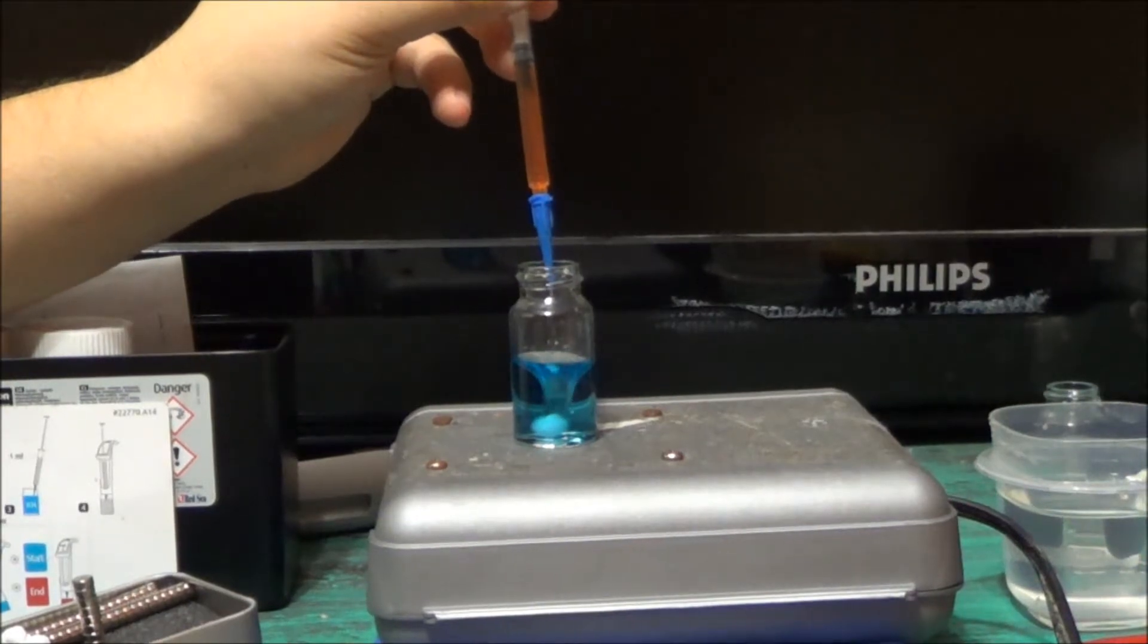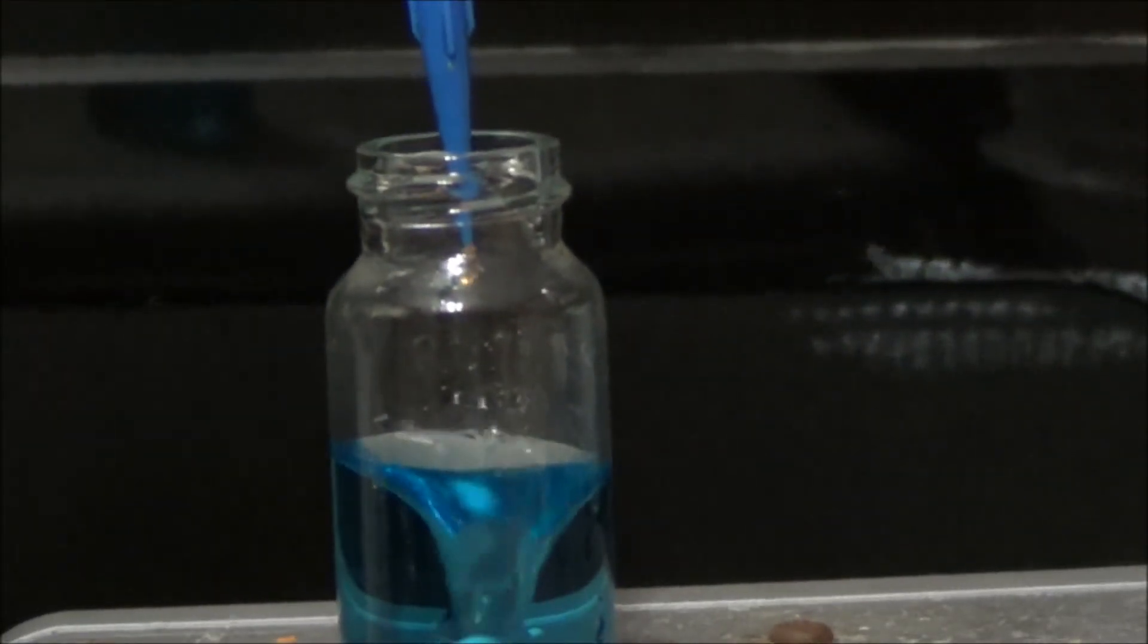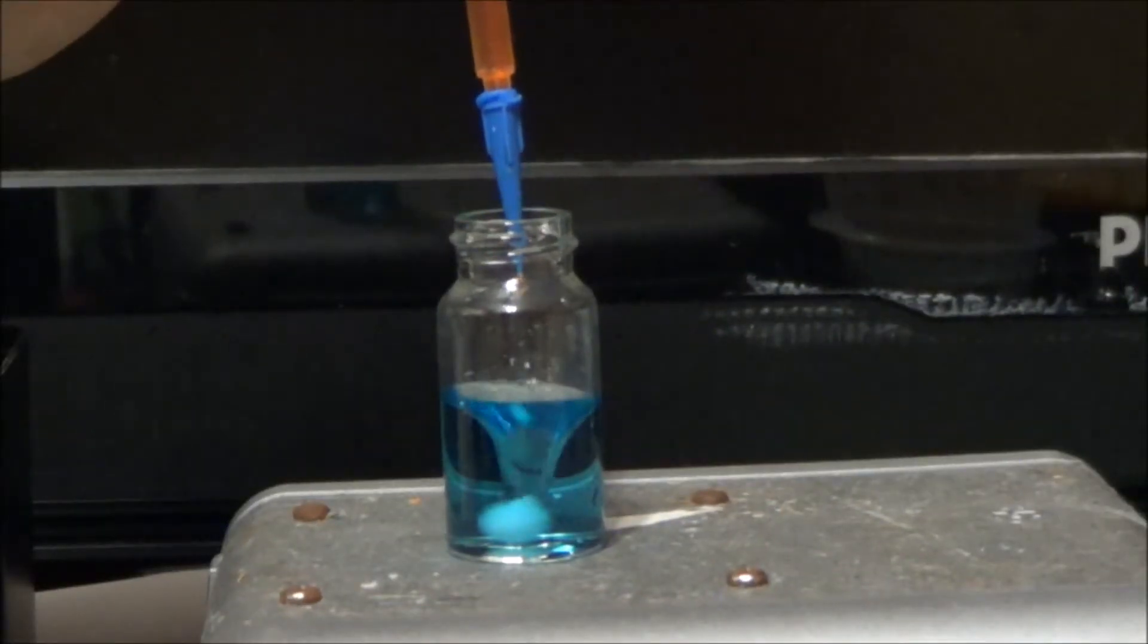Now I'm going to try to zoom in here, actually wrong way, there we go. Should be getting a little bit close now. One more. There we go. Now it's staying.